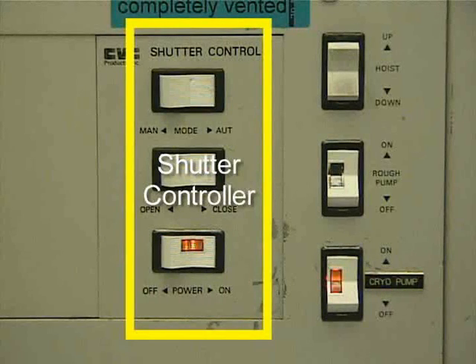The shutter control opens and closes the shutter. Usually, the shutter is controlled by the deposition monitor. The shutter is closed while the metal is being heated. Once the metal is evaporated at the correct rate, the shutter is opened, exposing the sample to the evaporation. Once the desired amount of metal has been deposited, the shutter is closed to prevent further deposition.